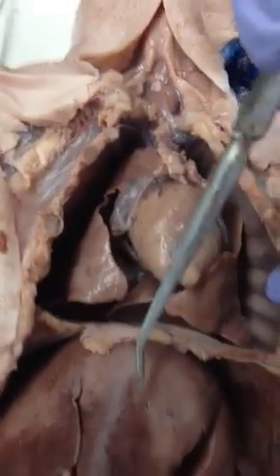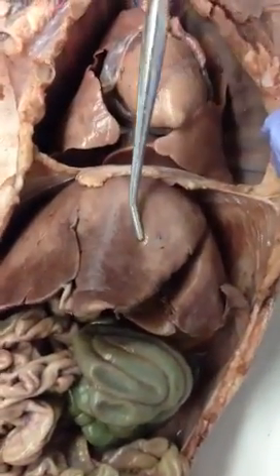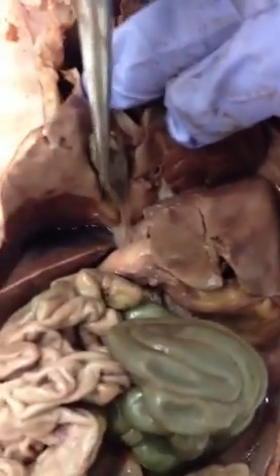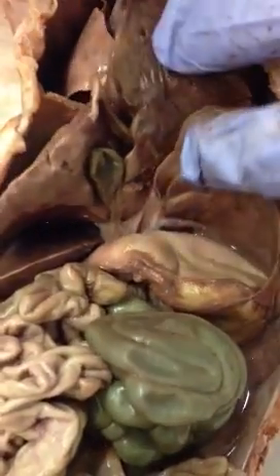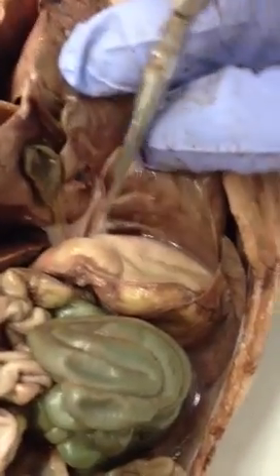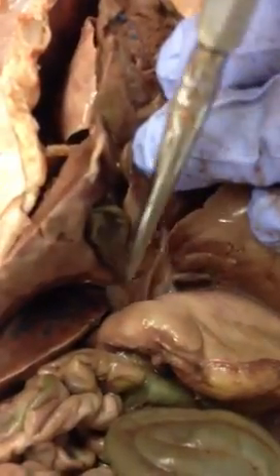Moving down, we've got the liver. We've got the right caudal lobe, the left caudal lobe, the left lateral lobe, and the right lateral lobe. This little greenish area is the gallbladder. It feeds into the cystic duct. The liver is fed by the hepatic duct. The two of them meet underneath this membrane at the common bile duct, which is surrounded by the sphincter of Oddi, which is smooth muscle.